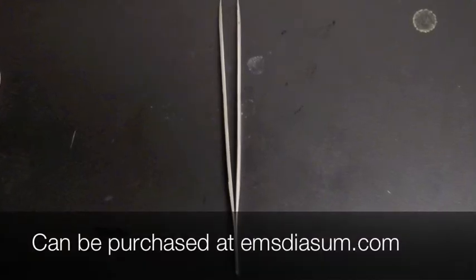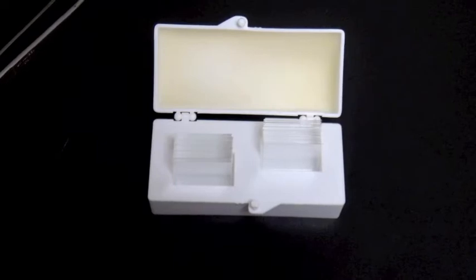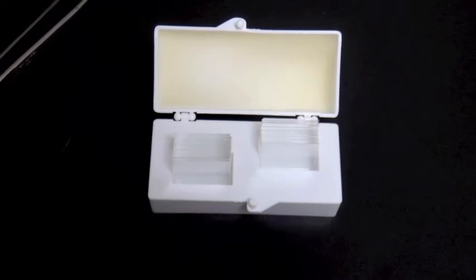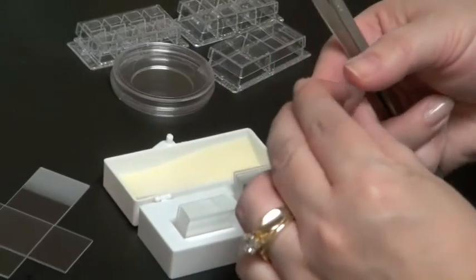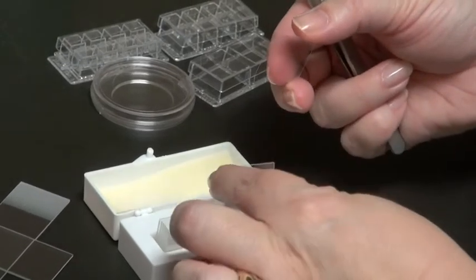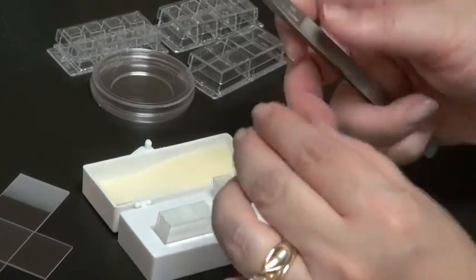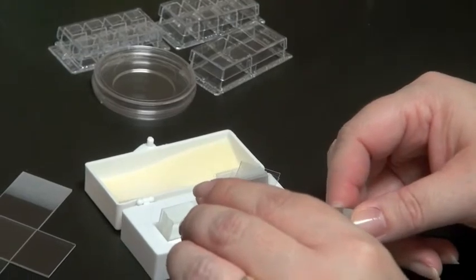Make sure that you're only taking one cover slip. This is very important and these are 1.5 cover glasses as well. You only want one. If you get it too thick you're not going to be able to see through to do your imaging.